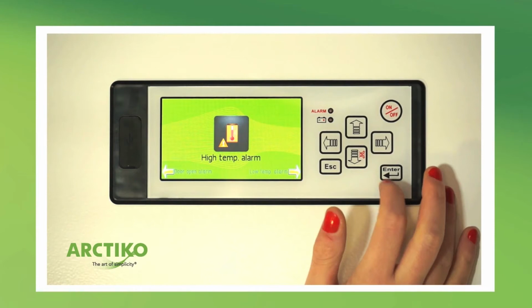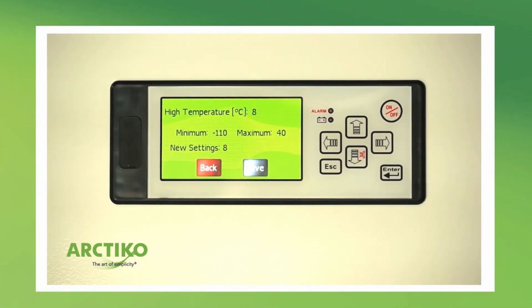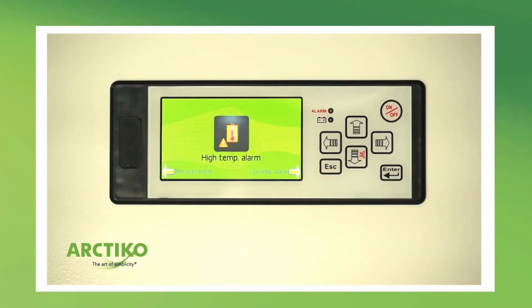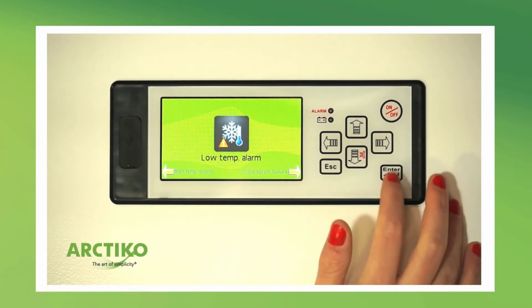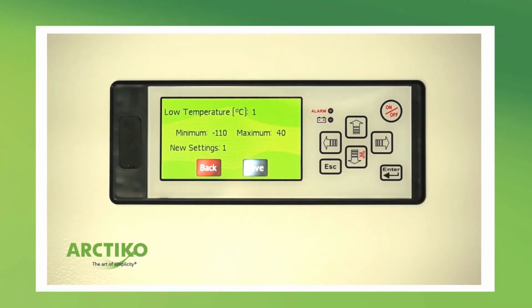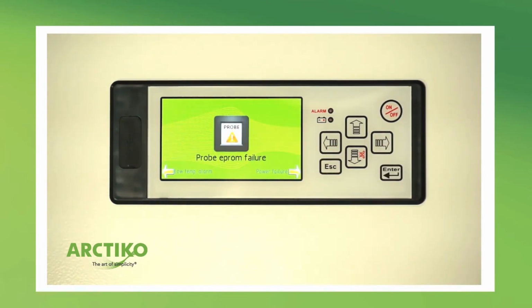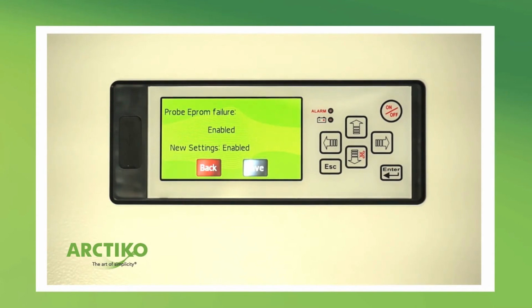In high temperature alarm, set the highest temperature the device can get inside before the alarm starts. In low temperature alarm, set the lowest temperature the device must be inside before the alarm starts. The probe EEPROM failure alarm indicates that the probe is not working.